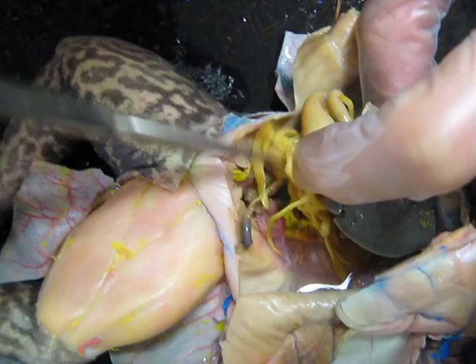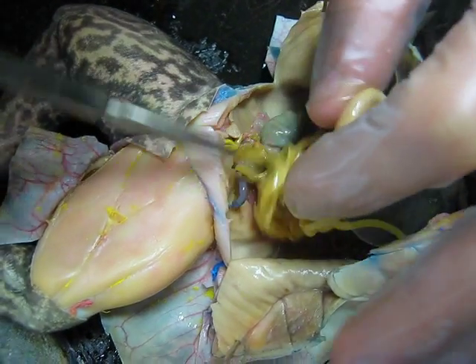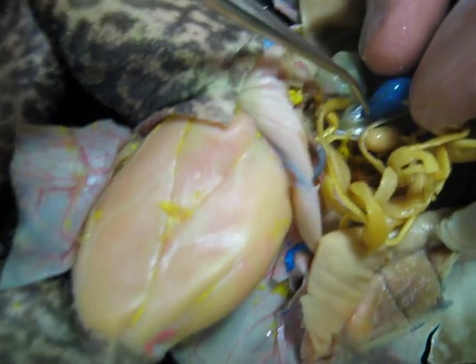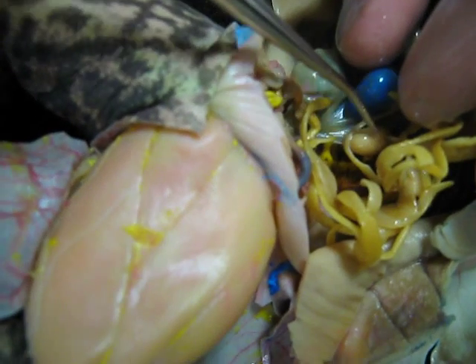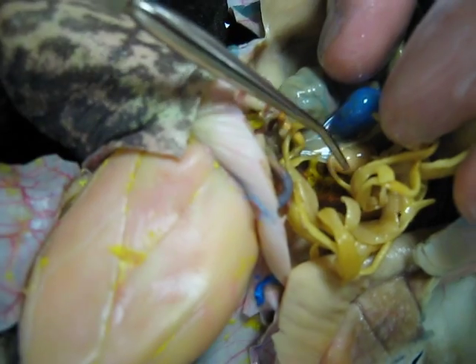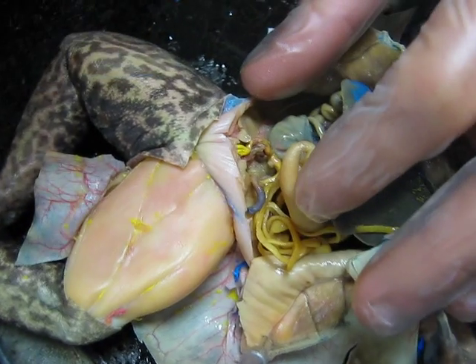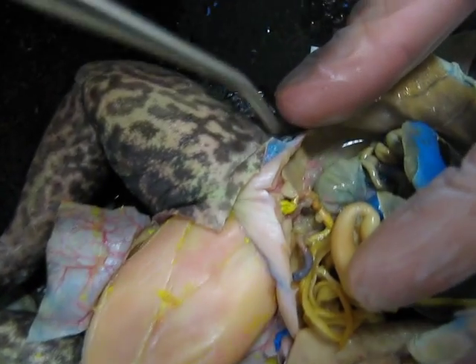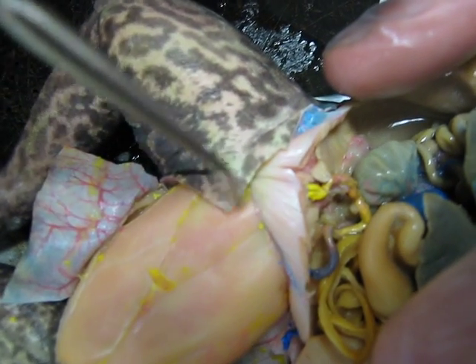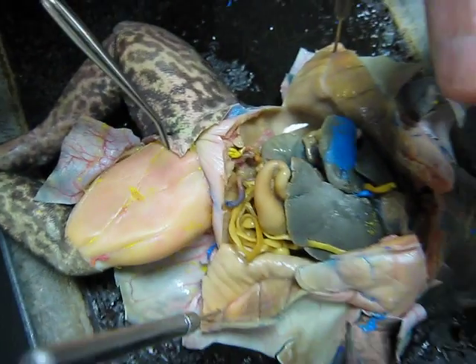These yellow convoluted lines are the fat bodies, and they go down to a testes, which is right here, kidney bean shaped. The cloaca is just down in this pelvis region, and I think that's everything.